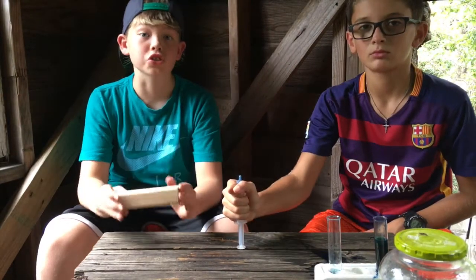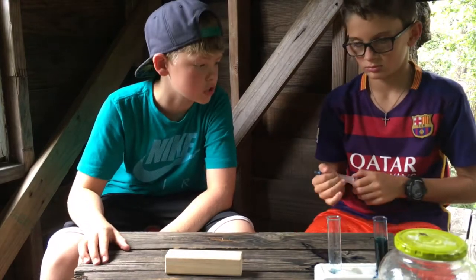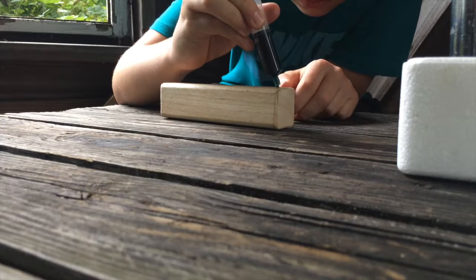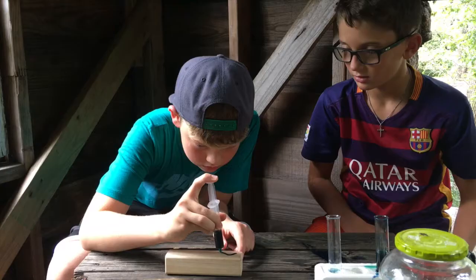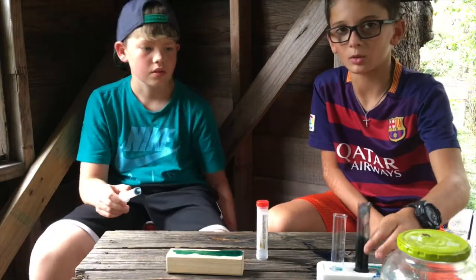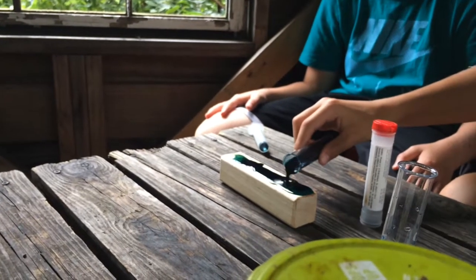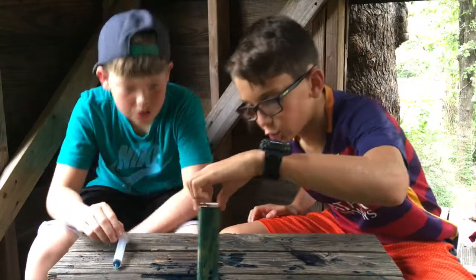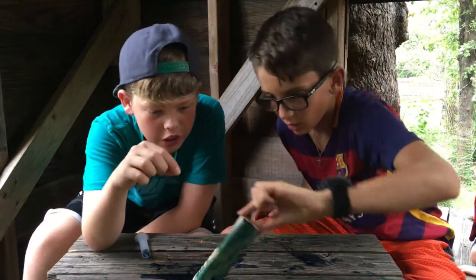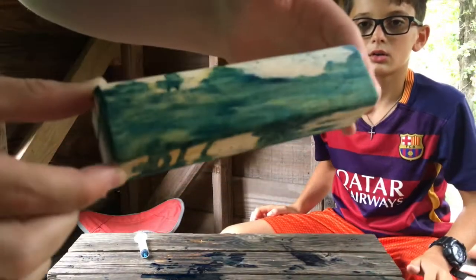So this dye was really strong, so we're going to put it to the test. We're going to be dyeing a piece of wood. It's green! Why is it green? Oh, it's blue — wait, no, it's green. We're going to dye some more wood. Dude, look at this — this is awesome! It's stained through the entire block. We took all the liquid off and it is still blue. Look at this, this is crazy.